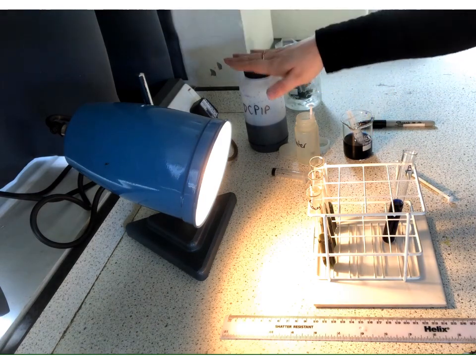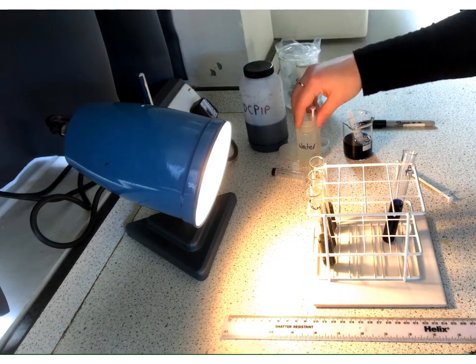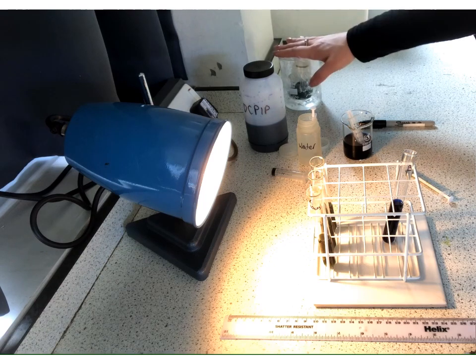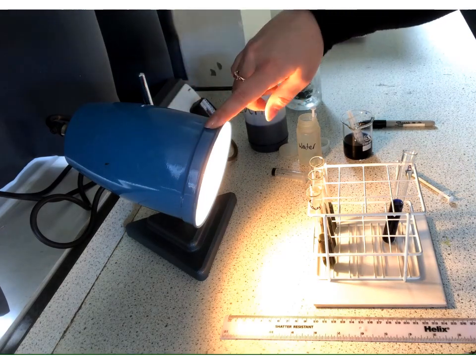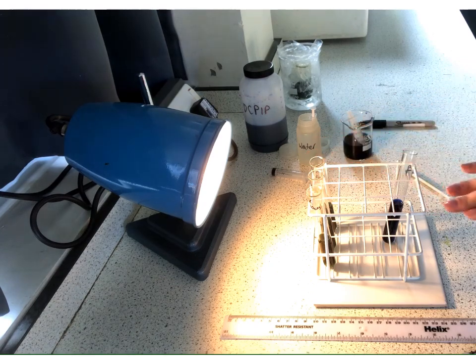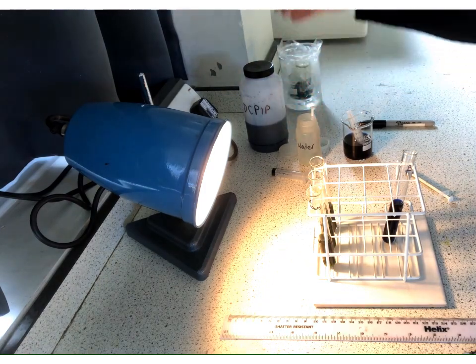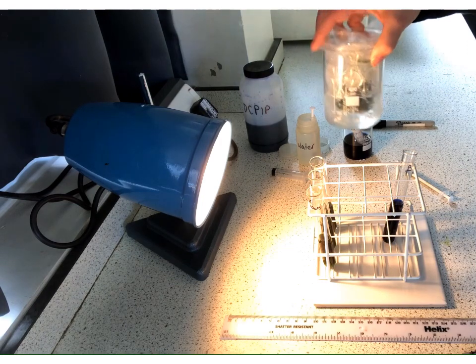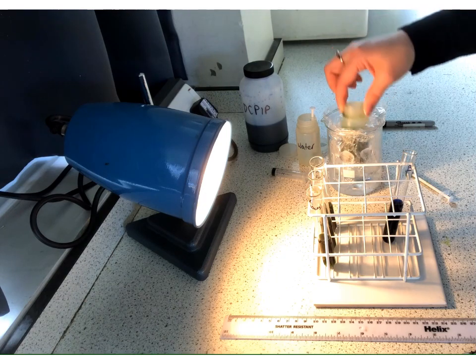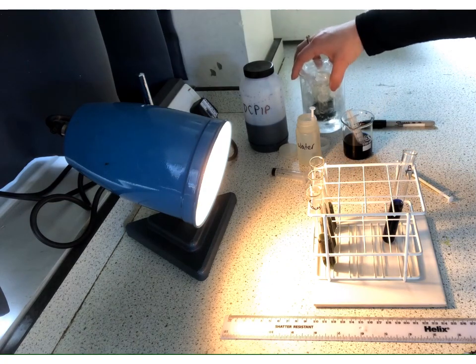We've used the same concentration and volume of DCPIP. We've used the same volume of water. We've used the exact same sample of chloroplast suspension and the same volume of it. We've used the exact same lamp, same source, so it's giving out the same amount of heat to both of them. And obviously what we would ideally do is take repeats so that we could calculate a mean and so that we could identify and discount any anomalies that we might get in our results. Okay, and we've kept things cool throughout, and the chloroplasts are suspended in a solution that is cold and isotonic. Interesting. So consider the reasonings behind that.